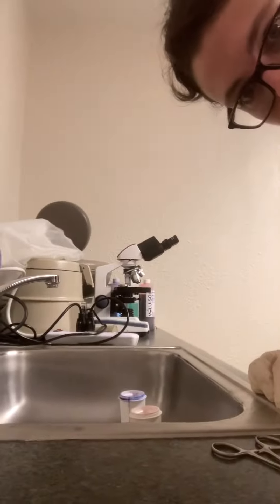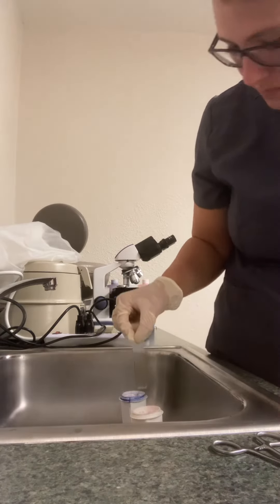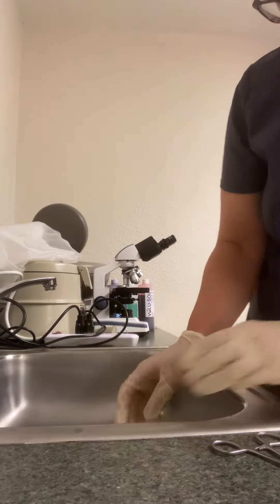It'll make sense when you open it because the lid is on the wrong side of the slide. Make sure you pull your tape off — 20 seconds. And you have to make sure your lid's off.